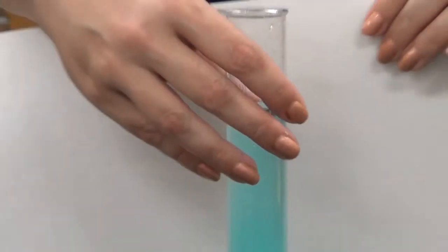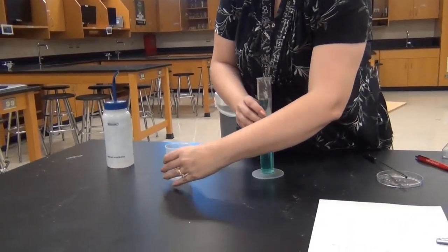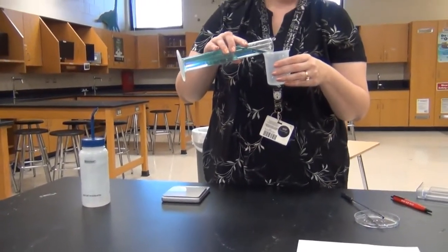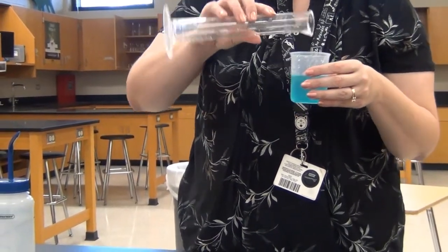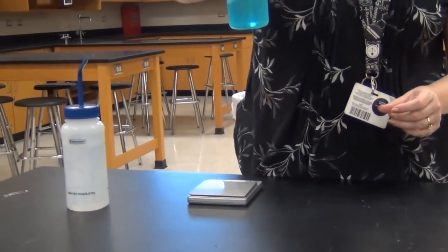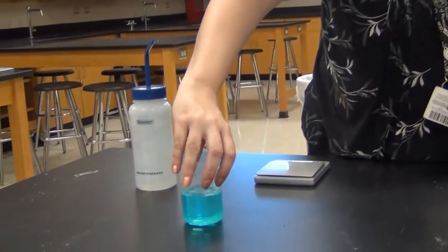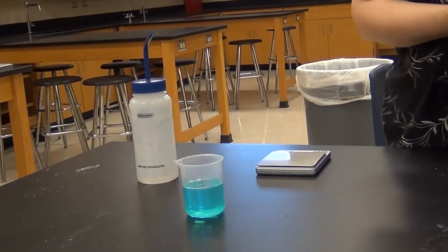Because I want to make sure that's totally stirred and mixed, I would put that into a beaker or a bottle. Stirring that up would make sure that it got all mixed and was homogeneous throughout. So I've just made 100 milliliters of copper chloride solution.